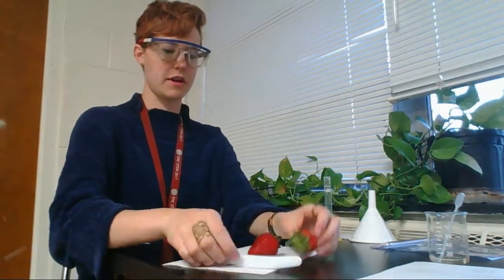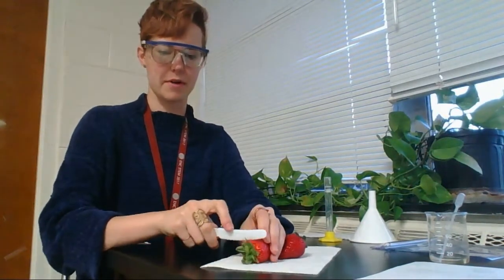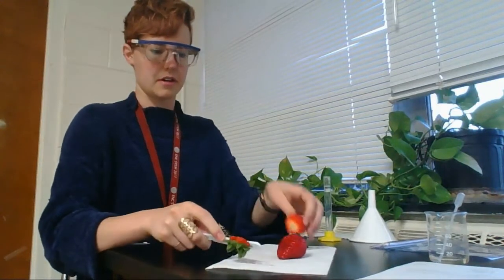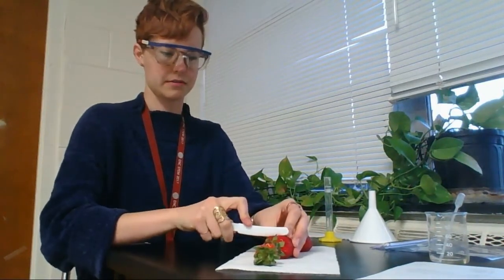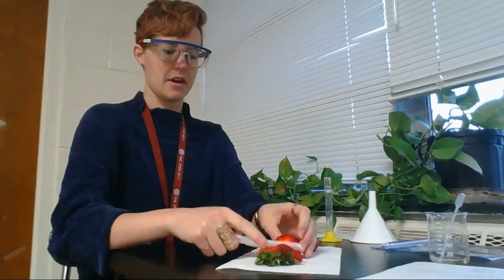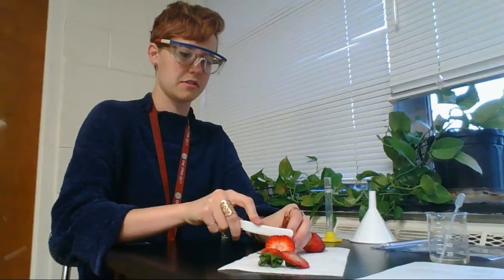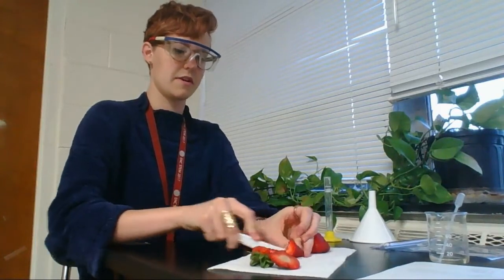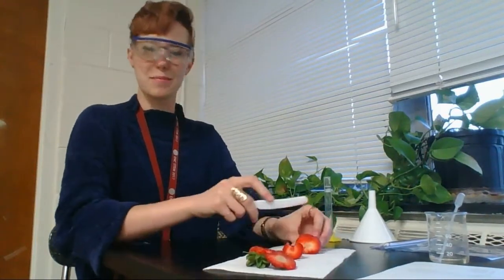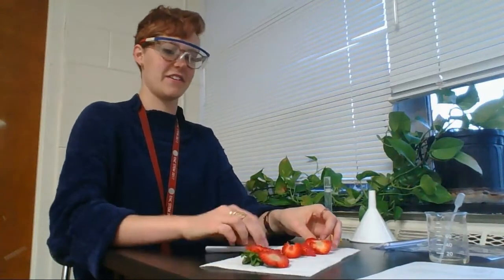All I'm doing right now is I'm cutting off the top of my strawberry. I'm going to cut the green top off, and then I'm going to kind of cut these down into some smaller chunks. This isn't super precise or anything like that, you just need to cut them up.